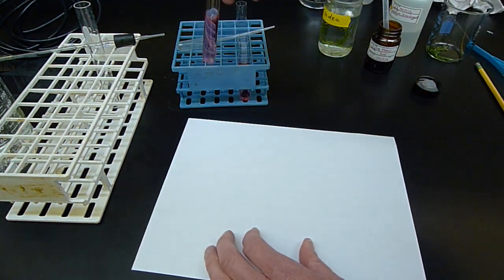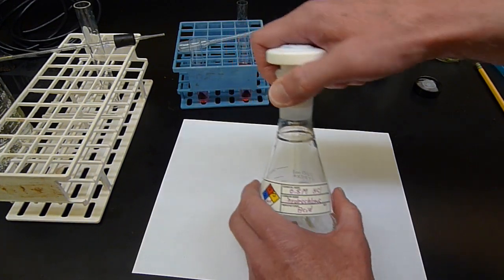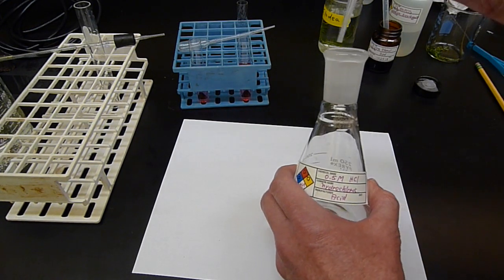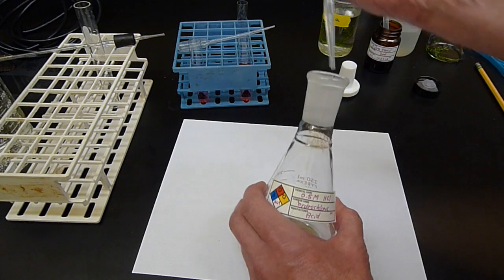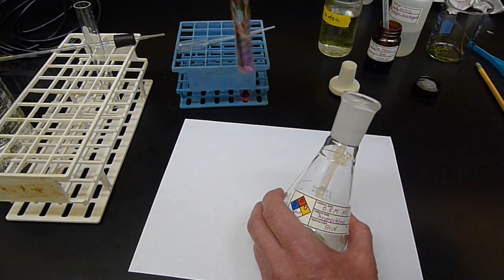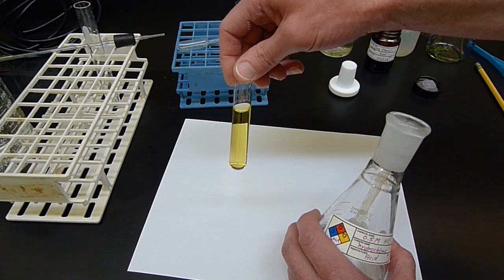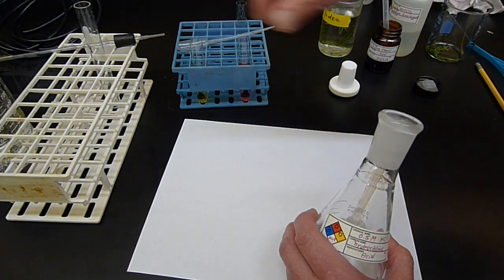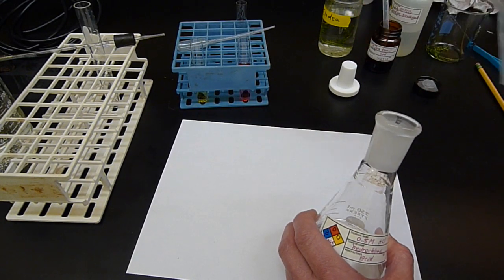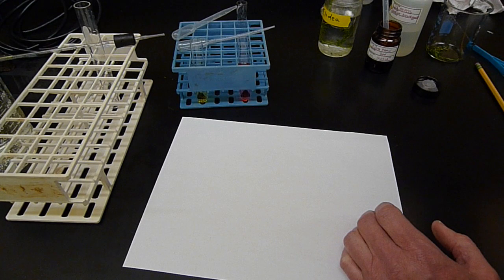So what I'm going to do is just to show you the color change first, I'm going to add some acid and base, just so you don't think I'm making it up. So here's some acid, 0.5 molar hydrochloric acid. I won't need much. Fairly dilute acid, but I'm only going to put a drop in. See what happens. And you can see just with one drop of that acid, it's turning yellowy already. Right, so not that much acid, you get a nice yellow color instead of red. Low pHs, under pH 6.8, it's going to be that yellowish color. And again, above 6.8, it will be more red.